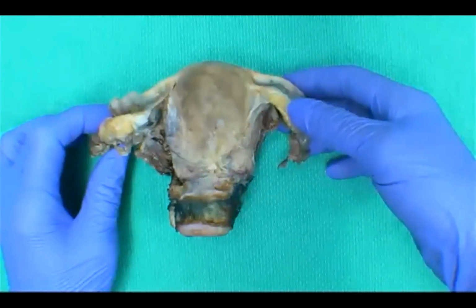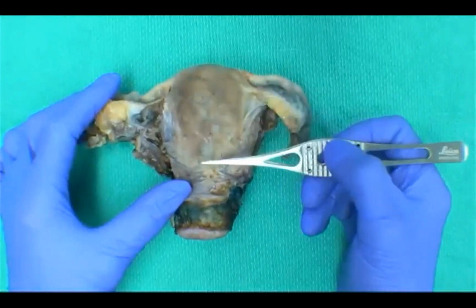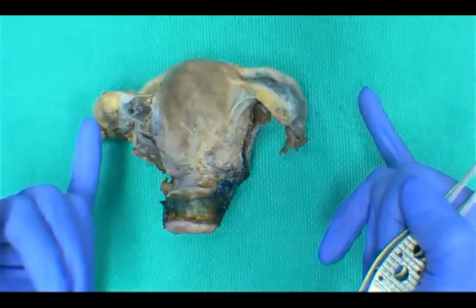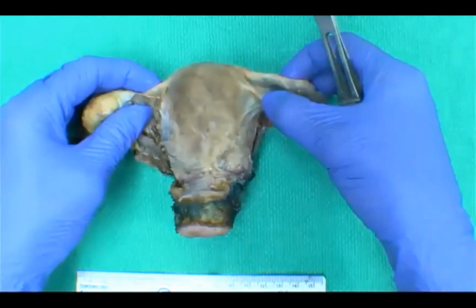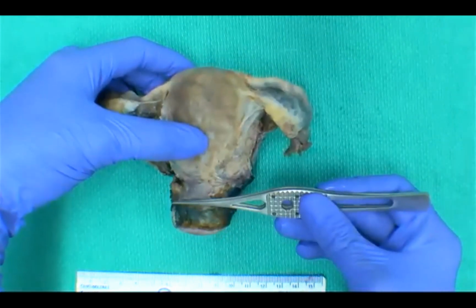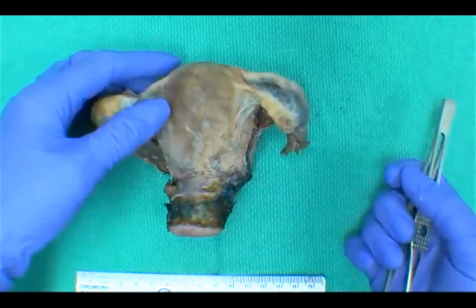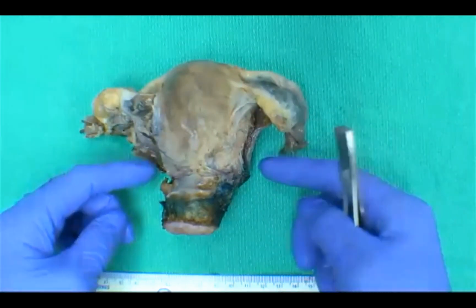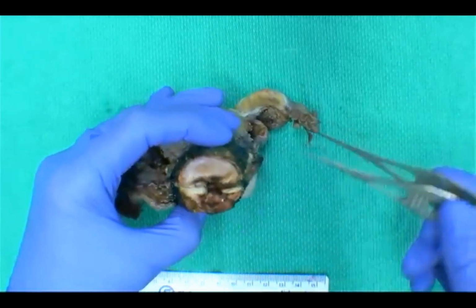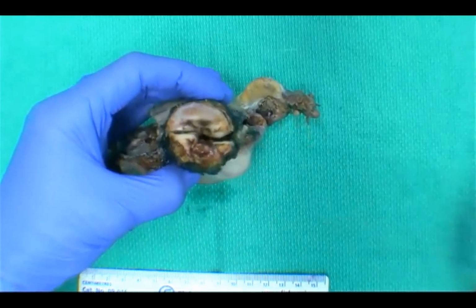So our first answer was a simple hysterectomy. That would include the corpus of the uterus and the cervix as well, but a simple hysterectomy doesn't necessarily contain both the fallopian tubes and ovaries. A subtotal hysterectomy would be a hysterectomy without the cervix. In a radical hysterectomy, you would expect parametria, which is soft tissue at the lateral aspects of the specimen, and also you would expect to see a larger rim of vaginal cuff along the circumference of the cervix.